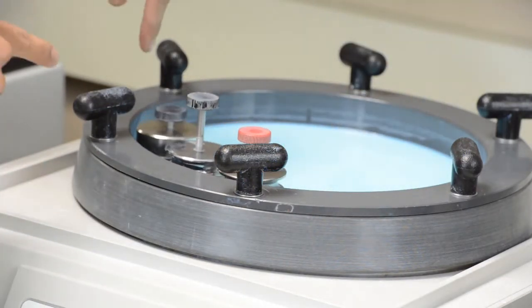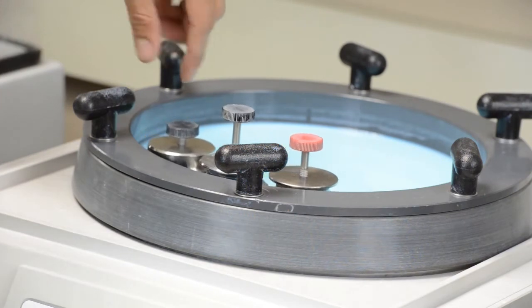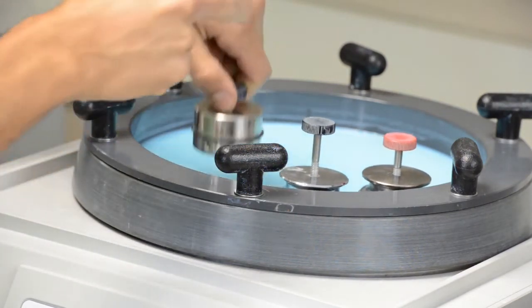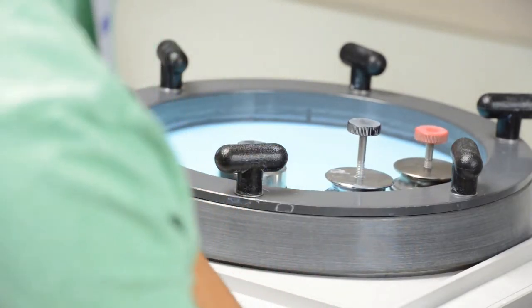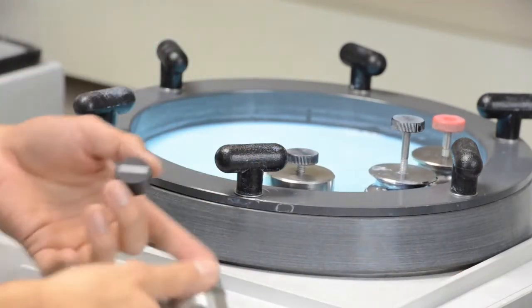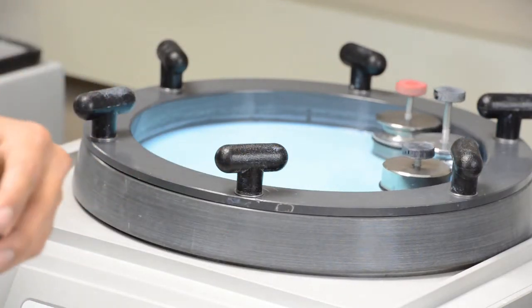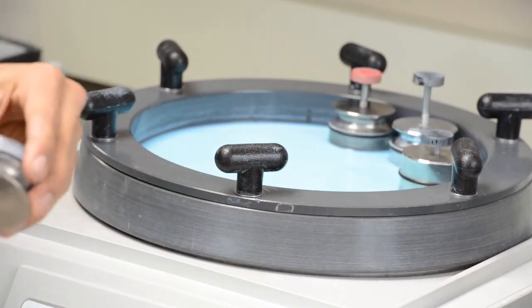Again. You hear that? This screw is not tightened properly. So let me tighten that. Whenever you hear a noise that is annoying, other than, well, maybe that one's annoying, but they get really annoying whenever something rattling. You don't want anything to rattle in there.